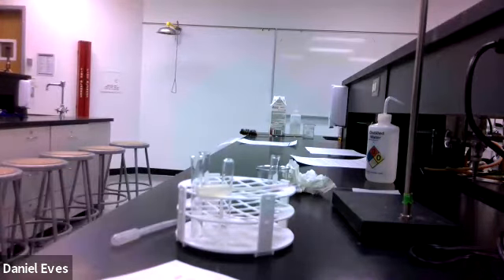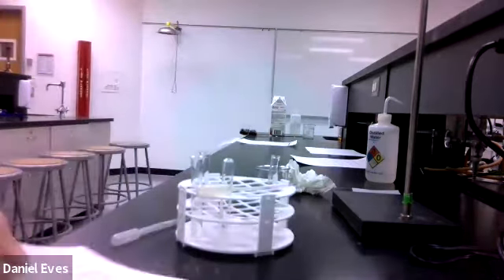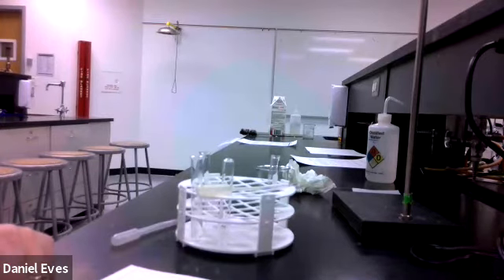That one, it's better to witness in person. So not much I can do about that one, but there it is. We've got one more experiment to go here. And so we'll get set up for that one.